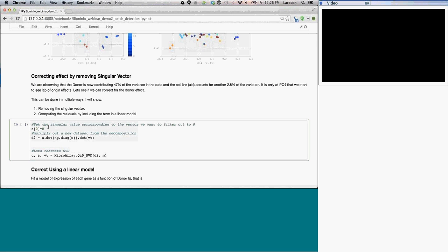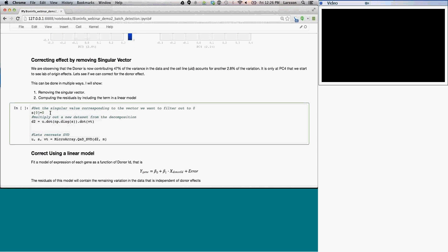The way I do that is I have my matrix S. I set the first singular value to 0, because it was the first vector that contained the information associated with donor. Then I multiply my U matrix with my S matrix and my V transpose matrix to reconstruct a data set where the first vectors in U and V transpose are now not a part of the data set, because S0 is equal to 0. And I'm going to do a new SVD, which is basically the SVD without that information in it.